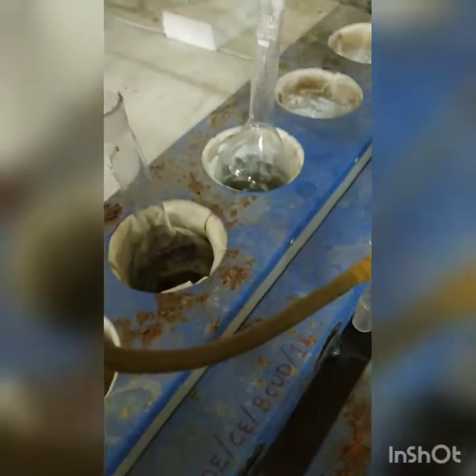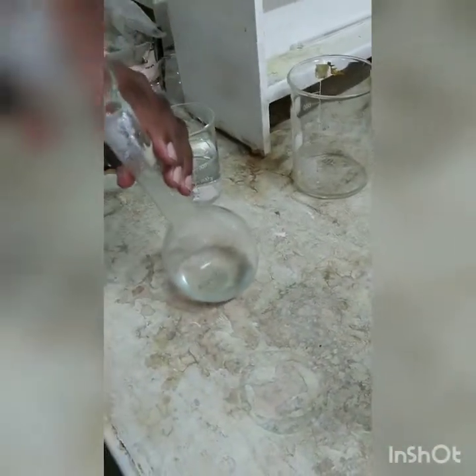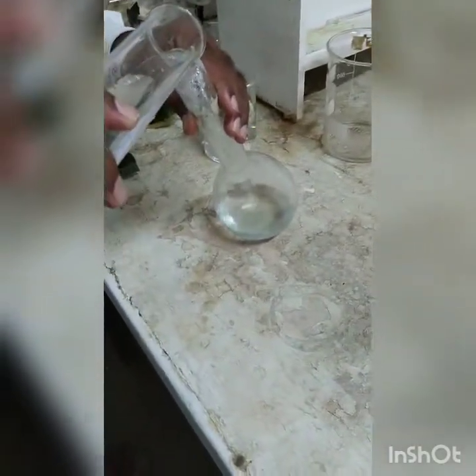So after about 5 to 10 minutes now we will stop the digestion and we will move to the further part of distillation. Now the digestion is over. The digestion flasks have come to room temperature. Now we are going to the distillation phase. So for that we are going to add about 250 ml of distilled water, as you can see, and we are going to make the total volume to around 300 ml.